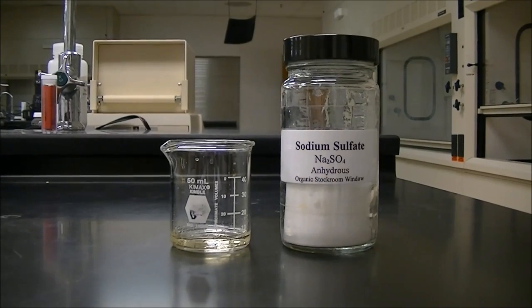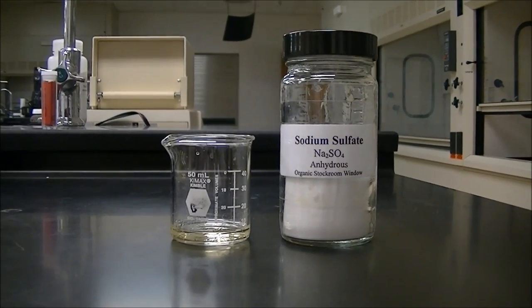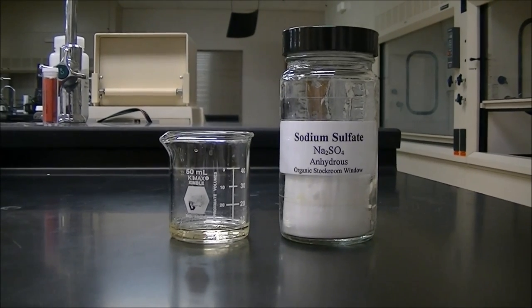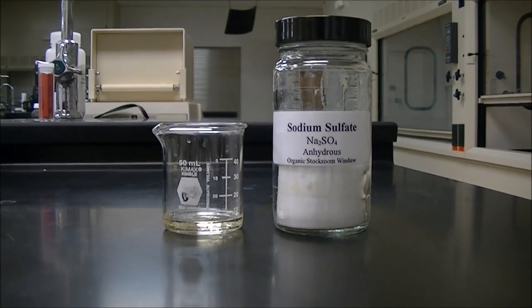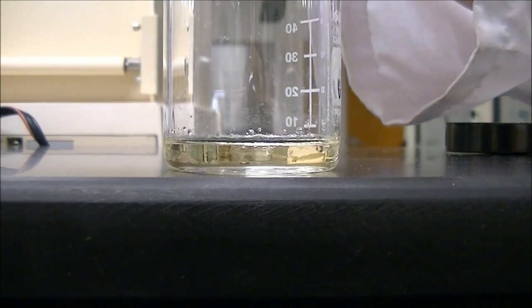After you've performed your extraction a total of three times, you're going to add sodium sulfate to your organic solution. What sodium sulfate does is it makes sure that we get all of the water out of our solution.